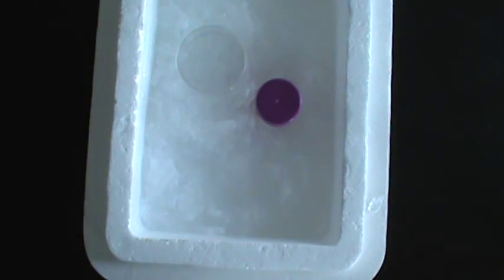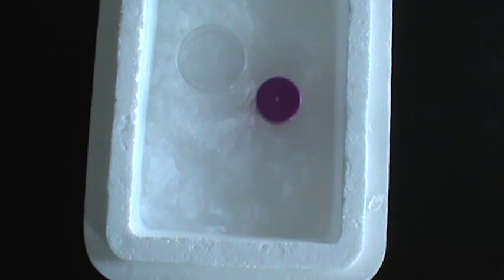two microscope slides, a syringe, and three different sized needles.